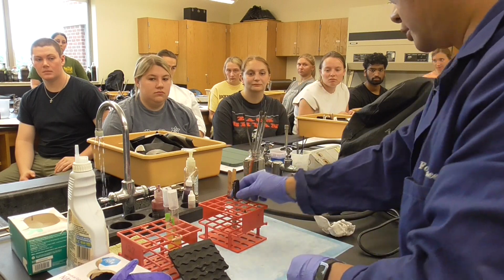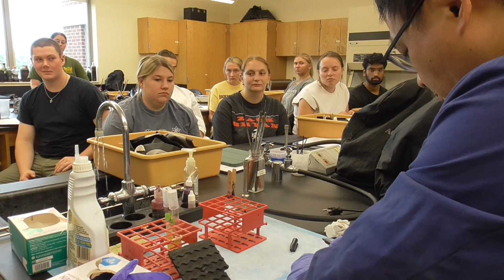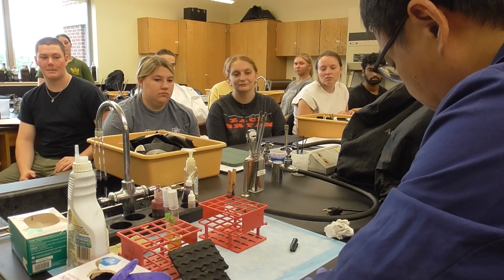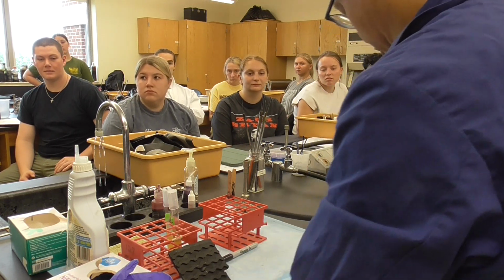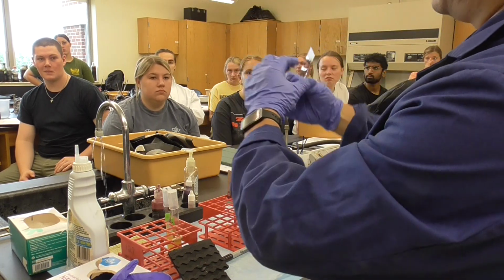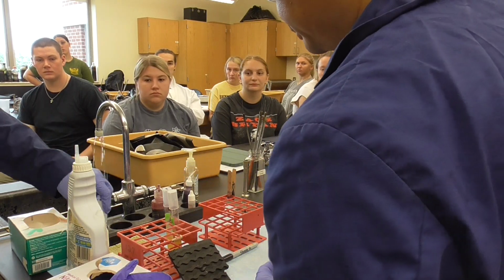Okay, now you're going to draw a circle. So you're going to draw two big circles. I'm going to label them EC and LF. So you can see it looks like this. Okay, then we flip it over. Just put one of each right here.